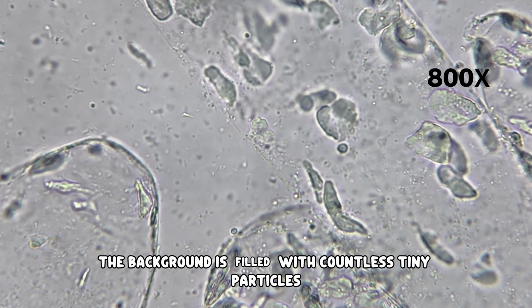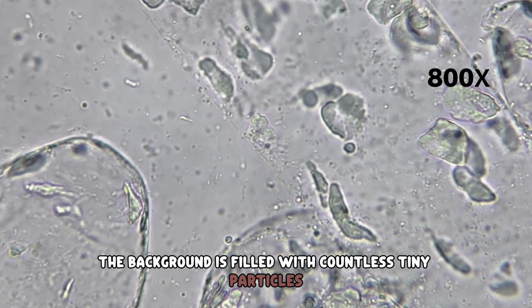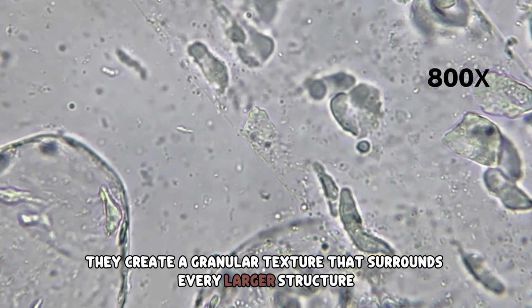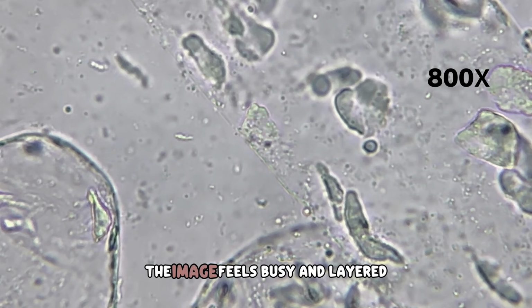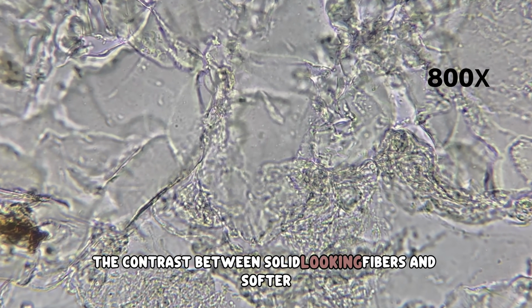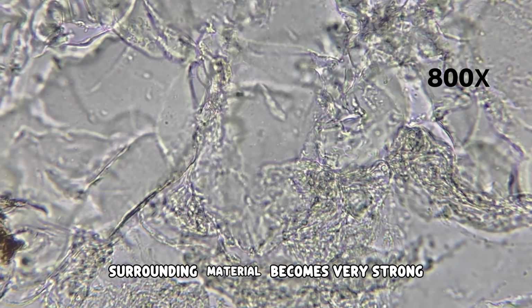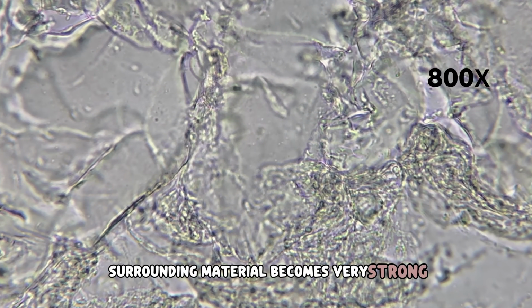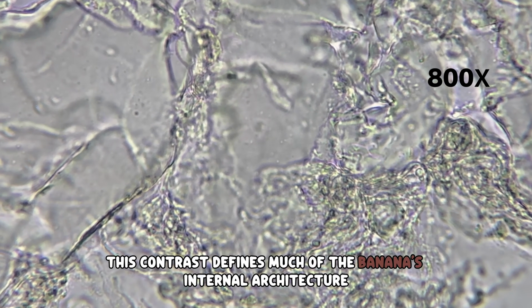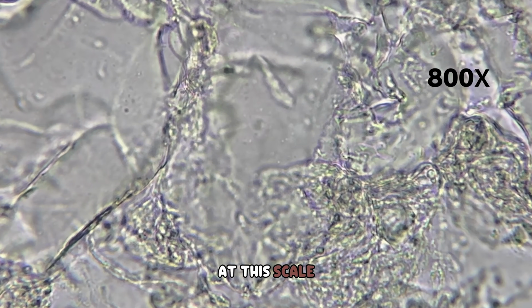The background is filled with countless tiny particles. They create a granular texture that surrounds every larger structure. The image feels busy and layered. The contrast between solid-looking fibers and softer surrounding material becomes very strong. This contrast defines much of the banana's internal architecture at this scale.